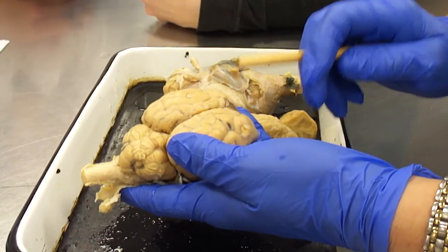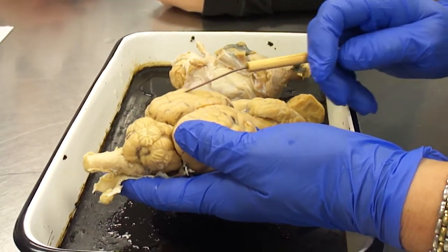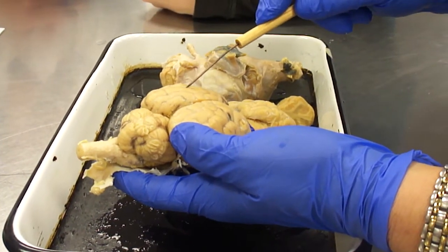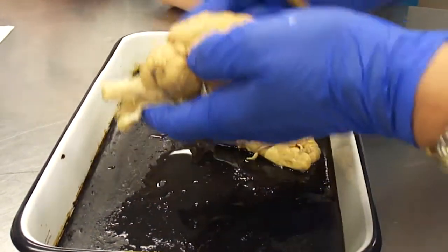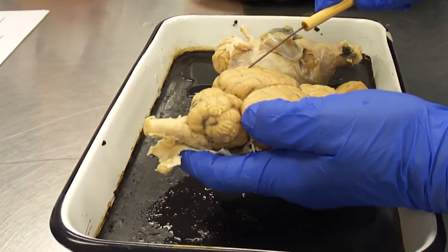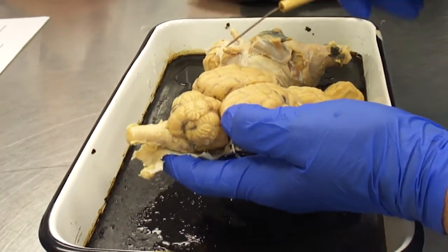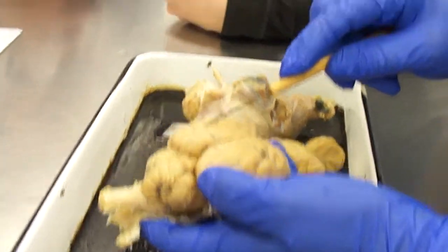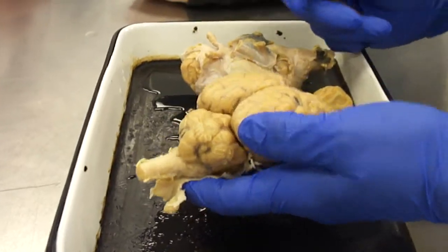Anyway, so that's the whole idea of the gyri and sulci, the grooves. Just like the groove on the horse hoof beside the frog was sulci, these are the grooves. I don't know if it's sulci or sulci, whatever. Doesn't matter, so long as you spell it right. Okay? And the folds are the gyri.